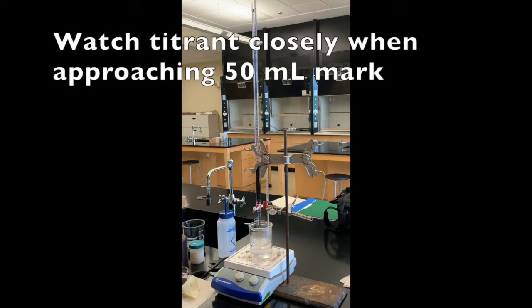When it's getting closer to the end of your burette or the bottom of your burette, you want to be careful not to go below the 50 mark. So watch it very carefully when you're starting to add this and you're still in the middle of a trial.